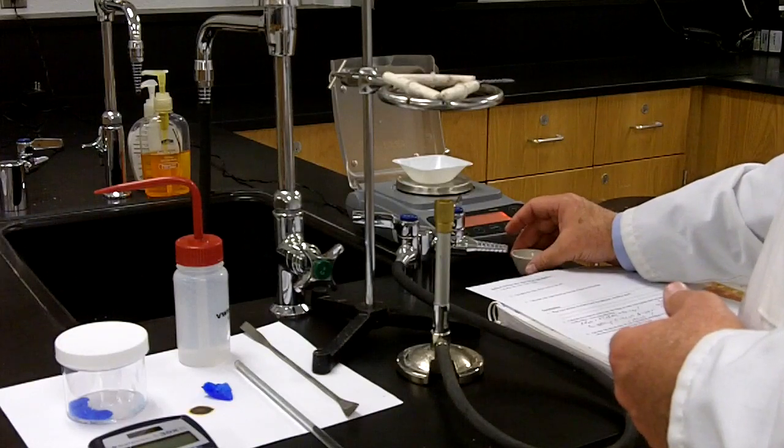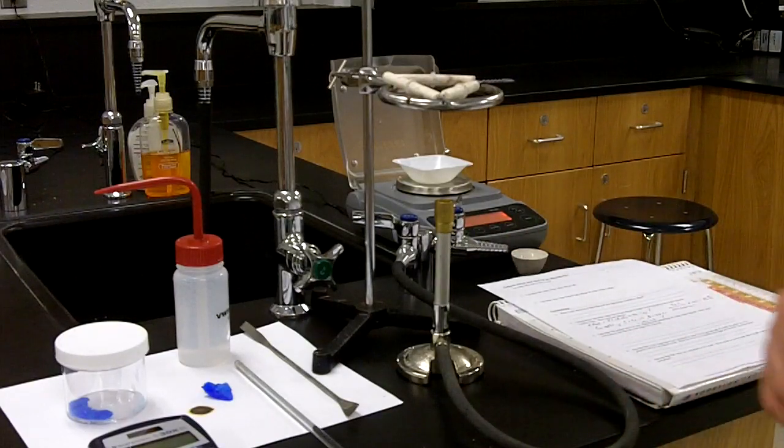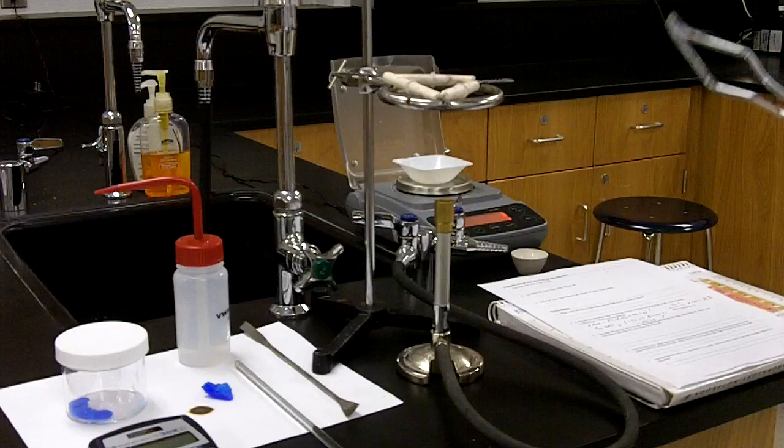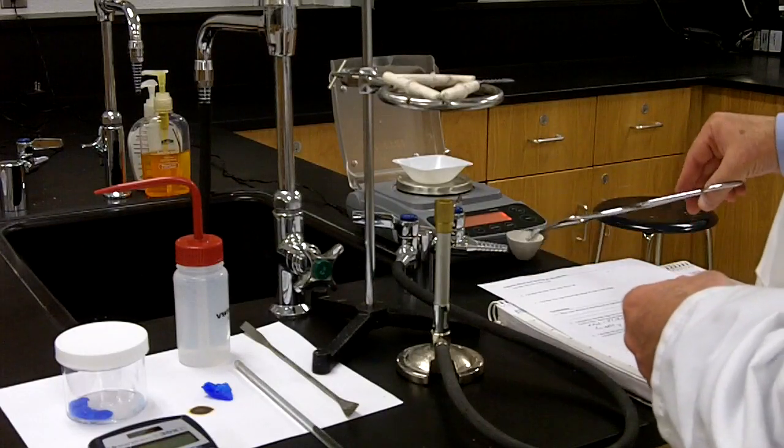All right. I think that's just about ready to be moved over to the scale, and we'll get a second reading. So this is the reading after heating.